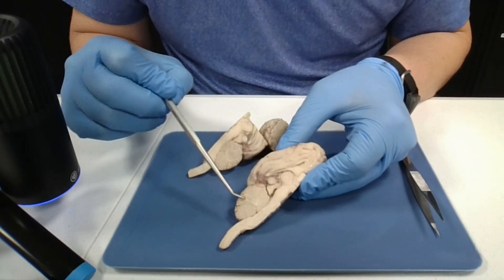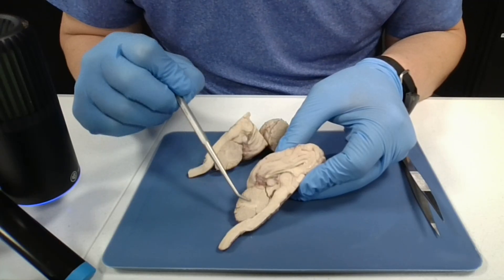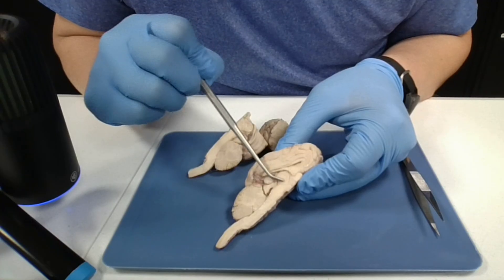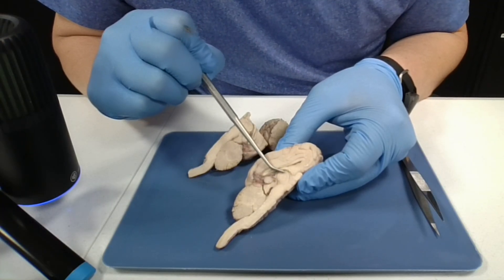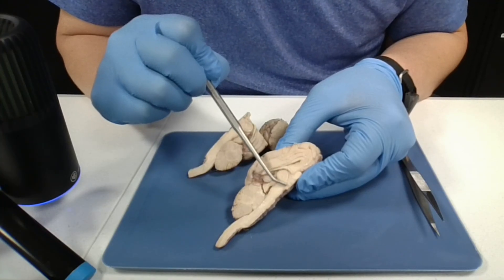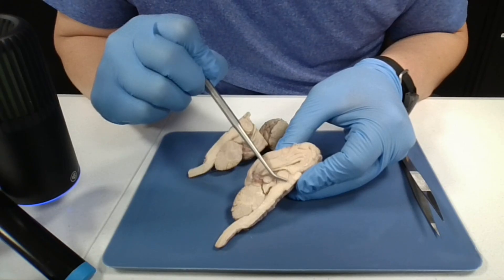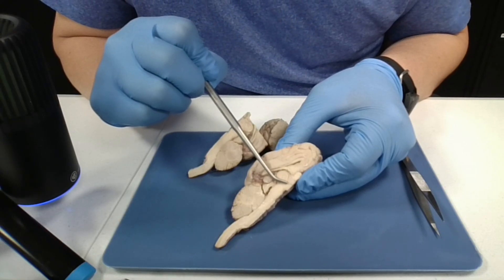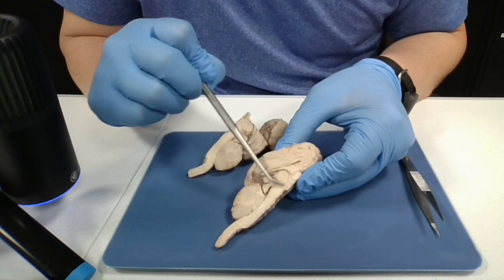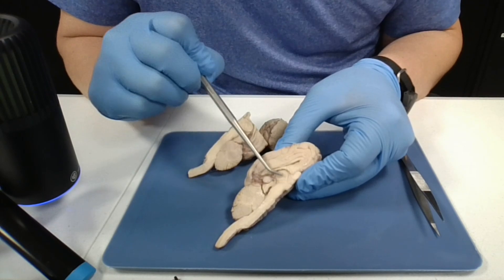The cerebellum is this structure right here, and it controls muscle coordination. The thalamus, which is this structure right here, is a sensory relay center for most of the brain. Underneath the thalamus, we have the hypothalamus, and he's responsible for homeostasis — body temperature, appetite, fluid intake. Together, they're called the diencephalon.